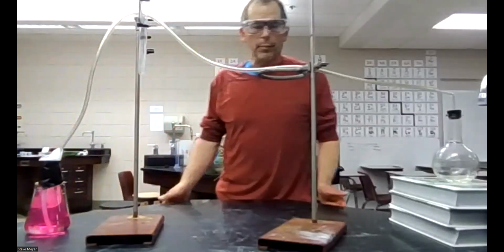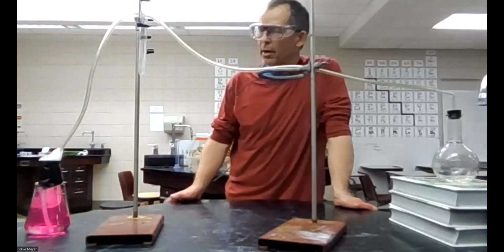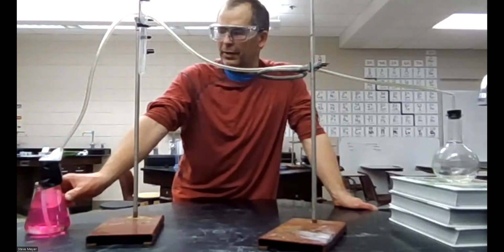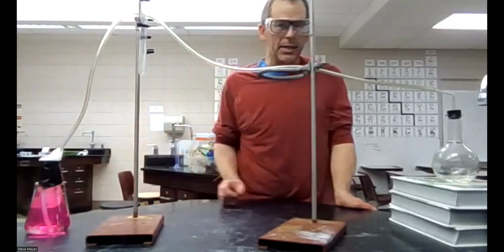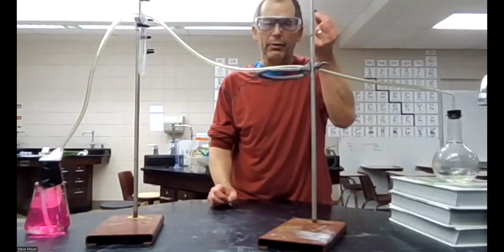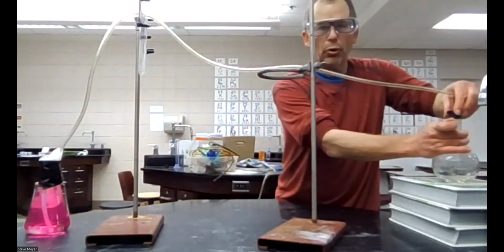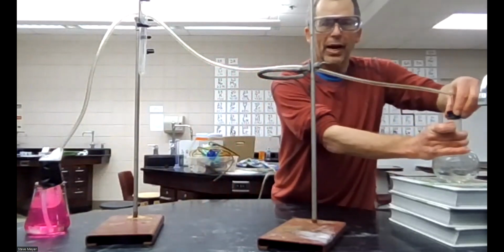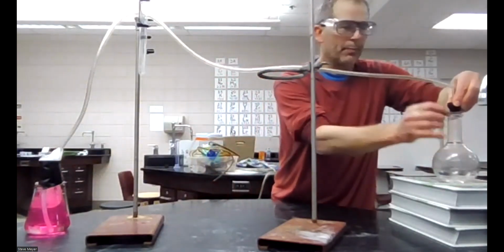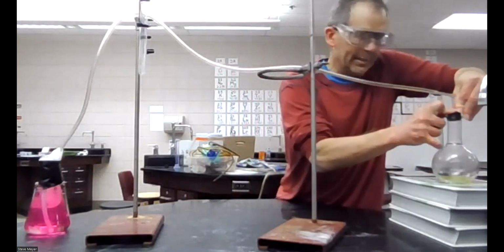This video is for number one on the challenge problems. We're going to give you a little visual of this right here. We have some water, some phenolphthalein, a little bit of sodium hydroxide in here, which is just kind of a side thing. I have a copper penny, which is one of the reactants, and I have 16 molarity stock grade nitric acid. So I'm going to put this penny in with the nitric acid.